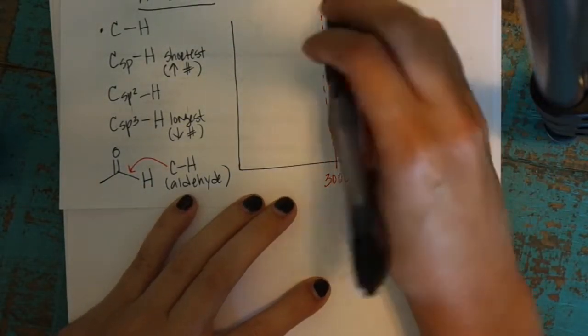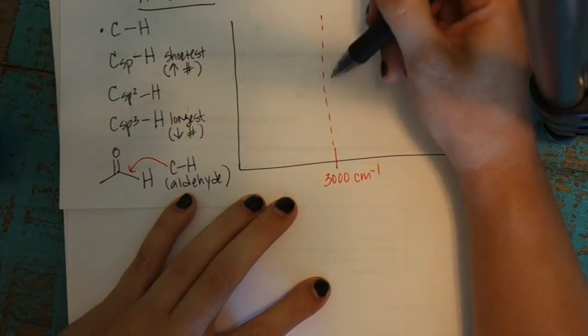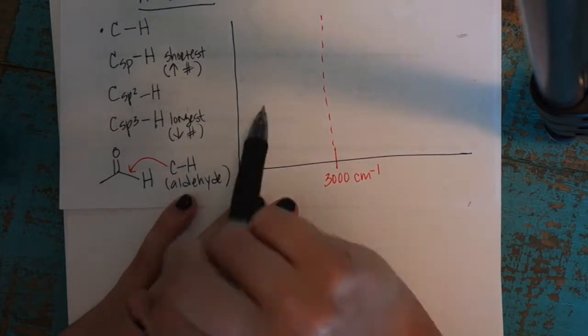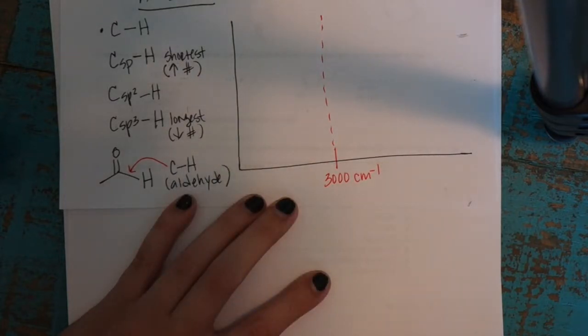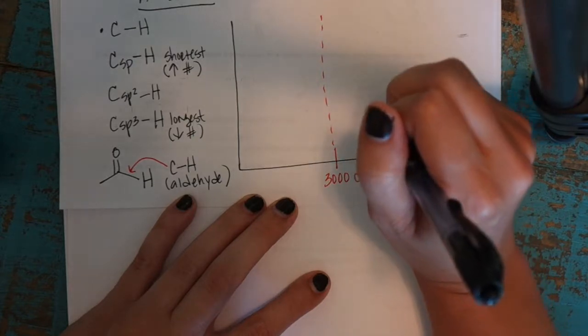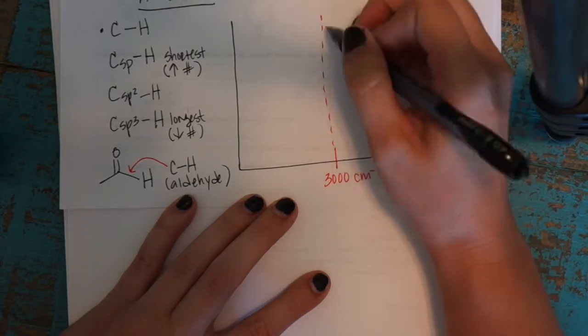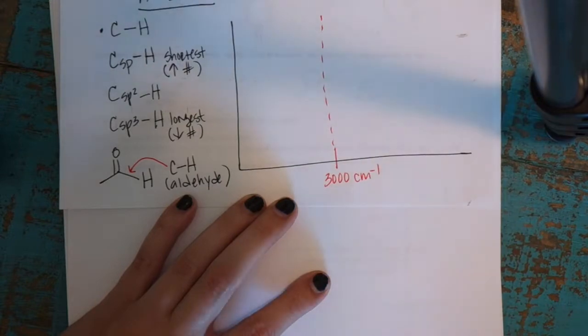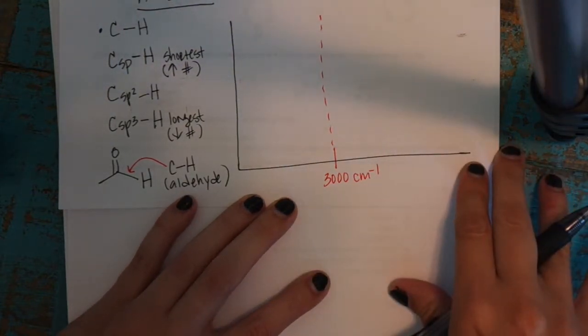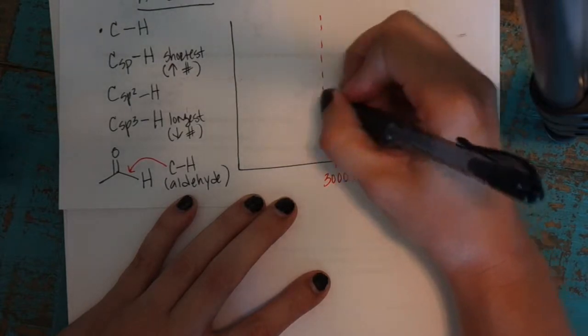Depending on the molecule, the CH region might be kind of messy because you might have a whole bunch of different CHs, all wiggling and vibrating as they go through the IR. Instead of just a nice sharp peak like we saw for the double bonds, you're going to see several jagged peaks. It's not so much about the number of peaks. The number of peaks doesn't really tell you anything. It's more where they are.